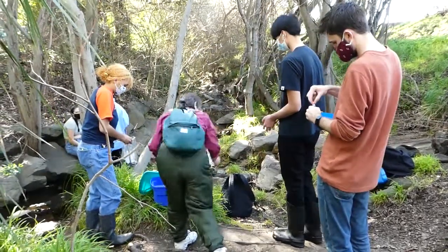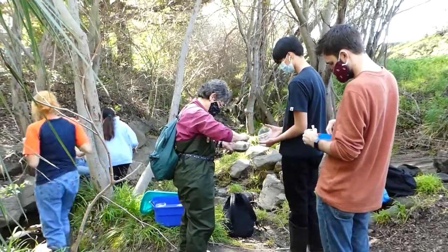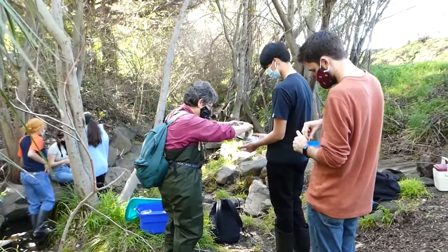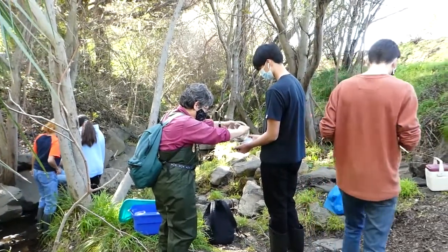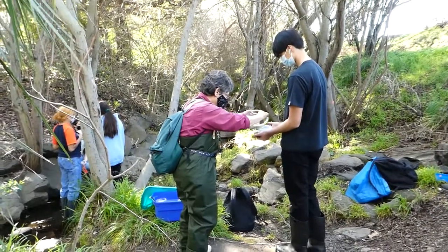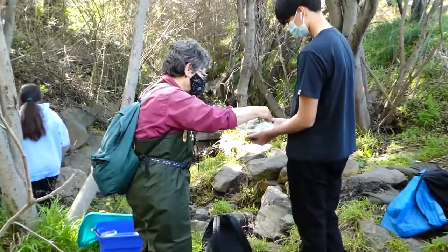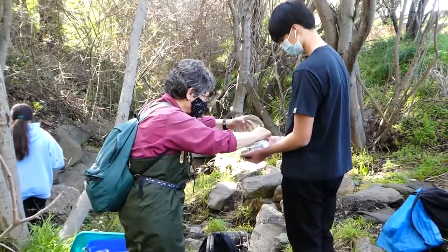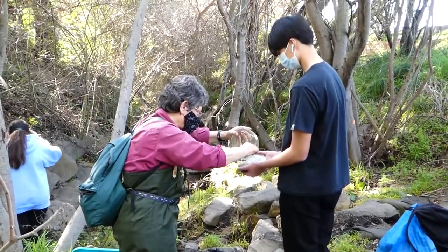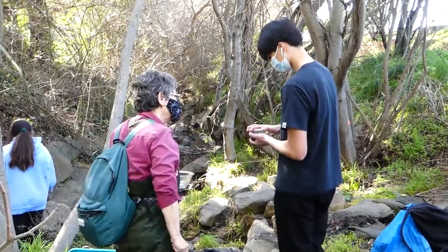I'm going to stir it into the box. Wash the mat. Hold it and I will aim the best I can. It's a little bit too wet but I think we'll still work with it. Without the dry weight we won't be able to do any comparison, so I'm glad we're doing both the weight of the sample and the dry weight to measure moisture.